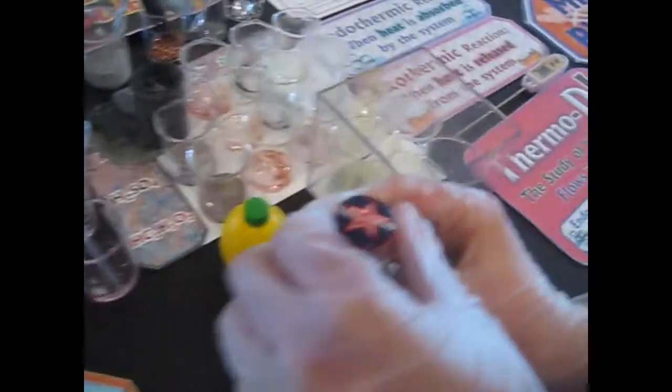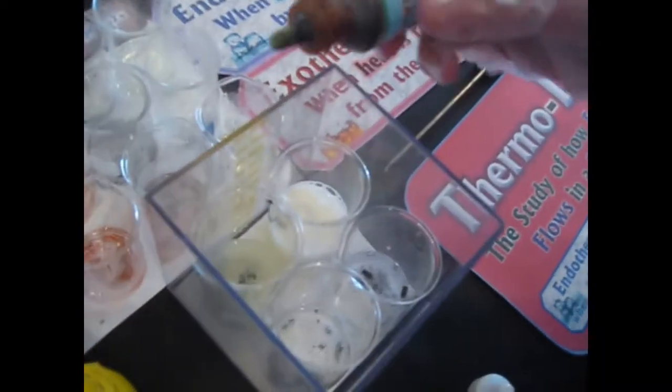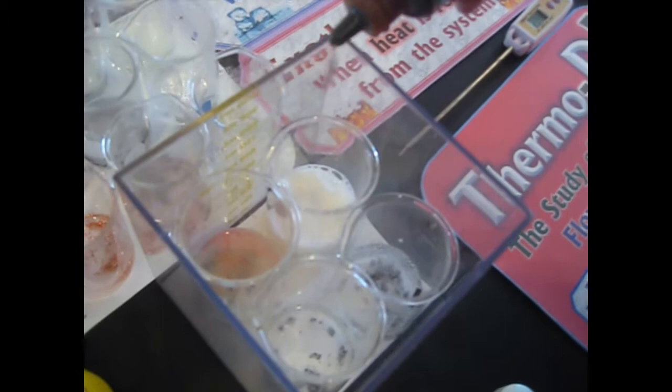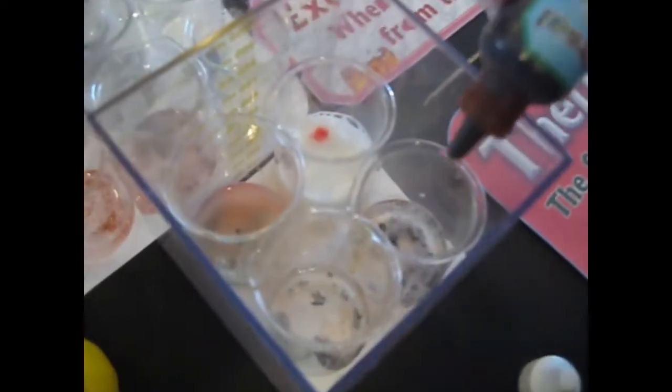Okay, and by the way, don't we want to see if they're acids? Are they really acids? Put some universal indicator in there. Maybe in this case, just a drop in each one. Okay, I'll try to get it exact. It doesn't have to be exact. Is it an acid? Maybe put another drop in. It's not very visible. Another drop in this one. Another drop in those two also.